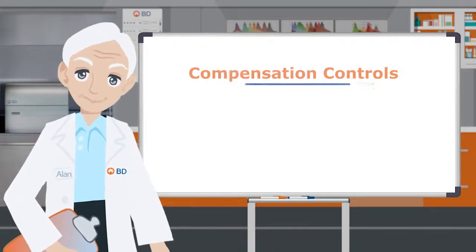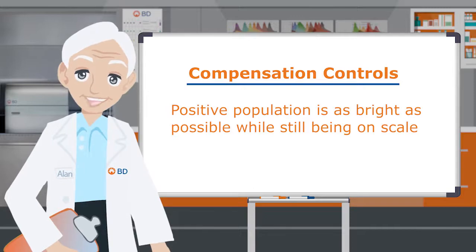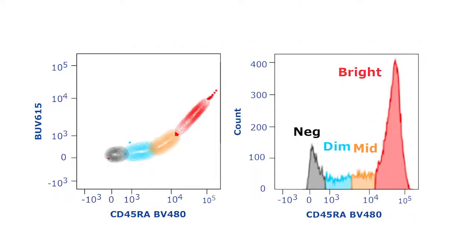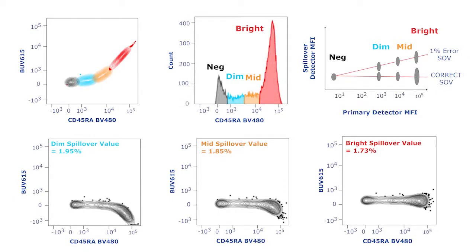The last principle requires that the positive population is as bright as possible while being still on scale. If you are using cells stained with a reagent with a broad range of fluorescence, as shown here with CD45RA, gate on the bright population, as shown in red, as your positive population. Errors in the spillover calculated from using dimmer cells are magnified at higher MFI. Correct compensation is best achieved when spillover values are calculated from the brightest population.